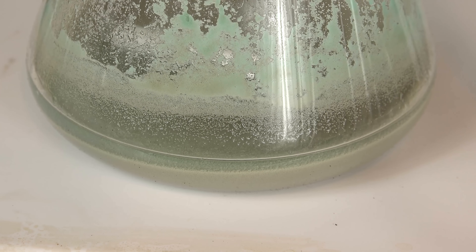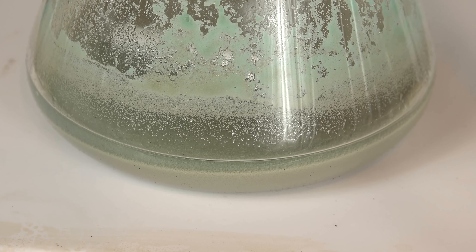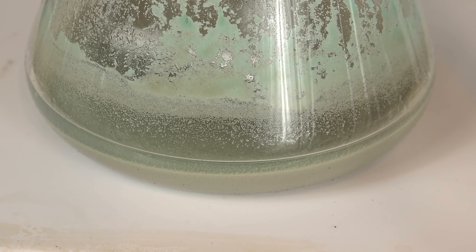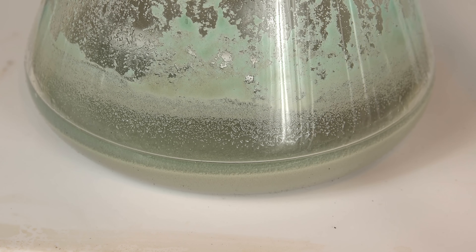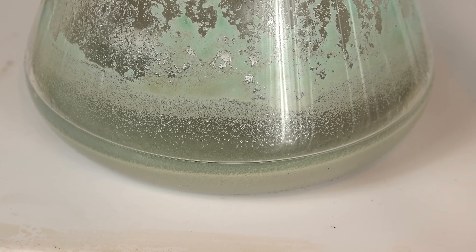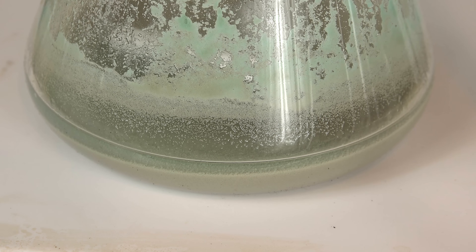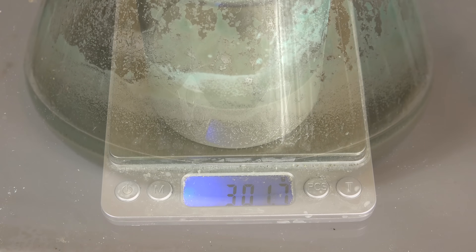As for the residue, this is a mixture of copper sulfate and sulfuric acid. It's white rather than the classic blue color because when you boil copper sulfate with excess sulfuric acid, the anhydrous white version precipitates out rather than the blue pentahydrate version. My copper sulfate is dirty gray because it also has other contaminants. Anyway, we can recover copper metal and the sulfuric acid from this corrosive slurry using electrochemistry.